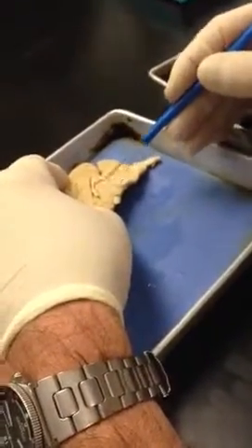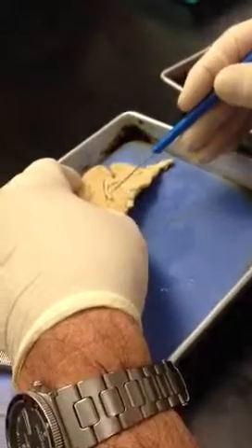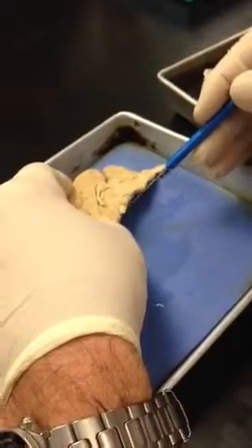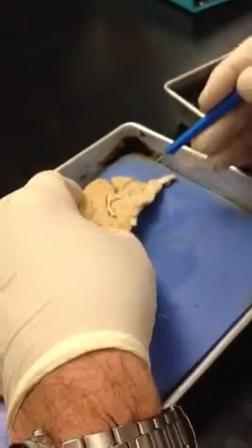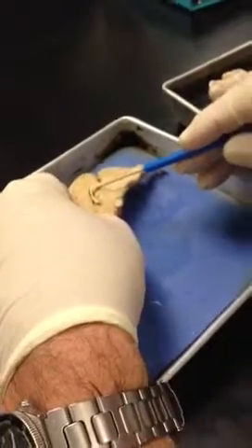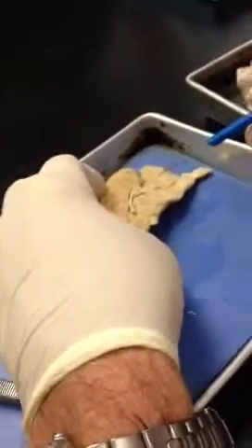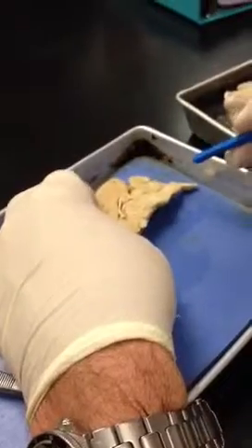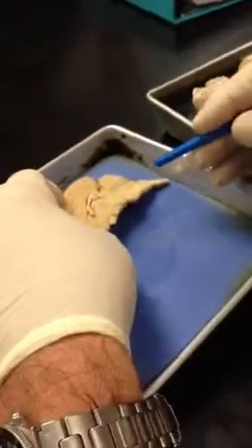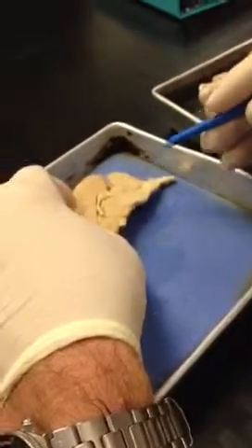This area right here is the thalamus, right around in here. The area down here in front of it, sort of right above the optic nerve, is the hypothalamus. The pineal gland kind of got cut a little bit, but it's right there. That's the pineal gland. And the cerebellum, the arbor vitae, but you can see there's this kind of, I don't know, mound of neural tissue right here.